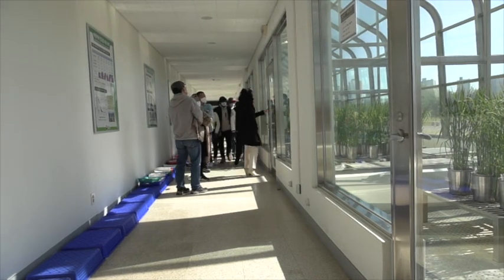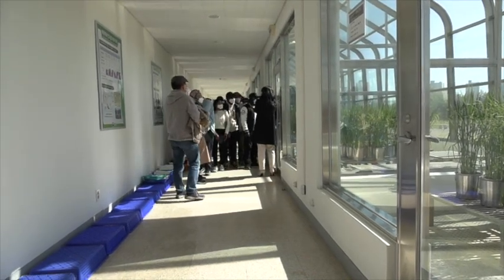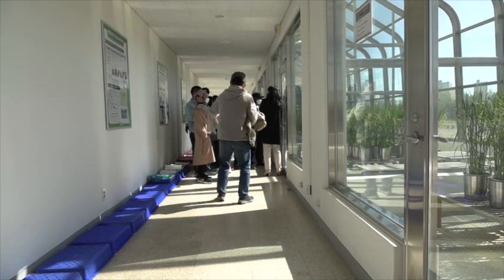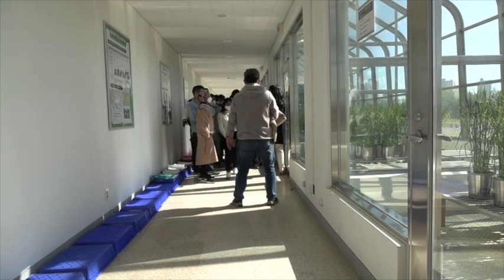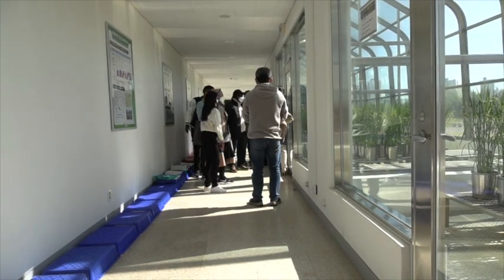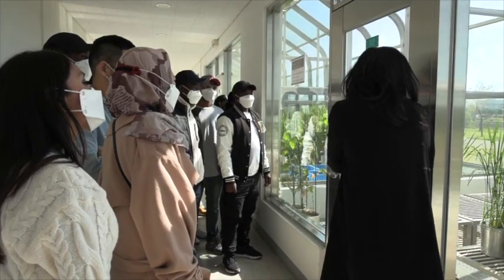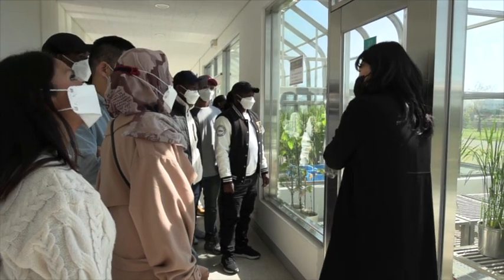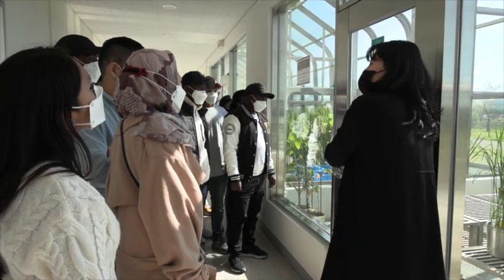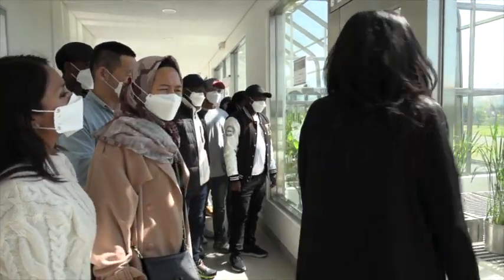It's a normal temperature for the summer in Korea. So if we are transplanting the rice a little earlier time, this temperature is appropriate. All the pots belong to different scientists, so we are just sharing the room.